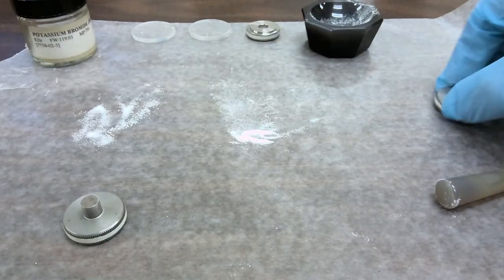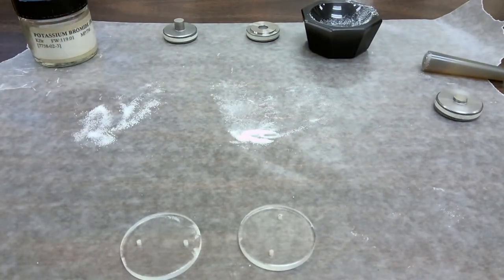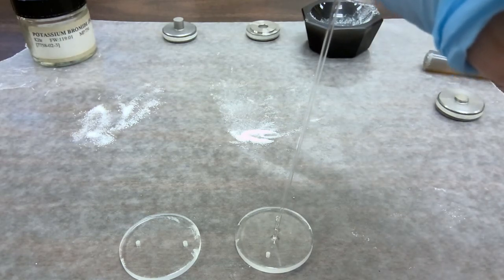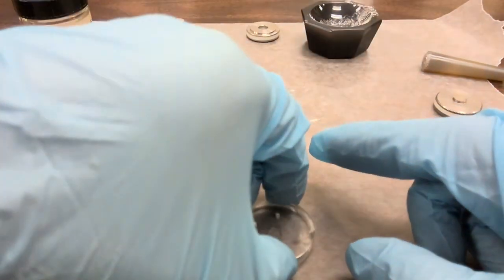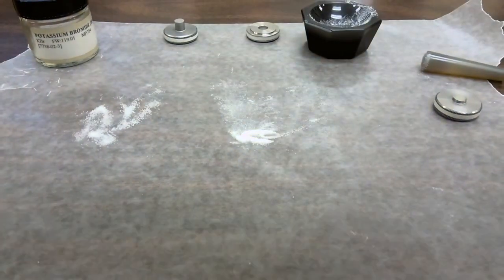Okay, so let's take a liquid film IR spectra. So we have our two salt plates. We have our product mixture. And now what we're going to do is deposit our sample onto the plate. Okay, perfect. So we're now all ready. We're going to compress our sample between the two plates, and we're going to record the IR spectra for our product, ethyl ester.